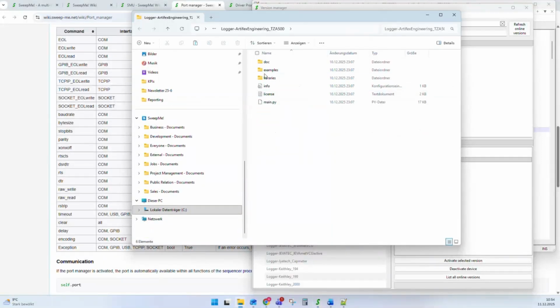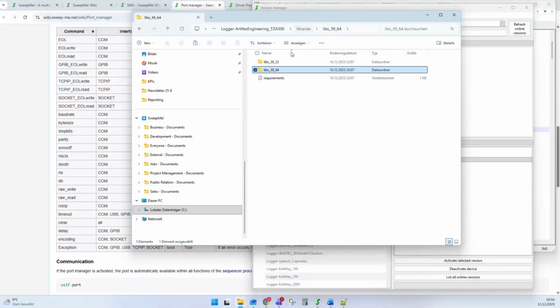And we can see you can add a libraries folder to your driver. And in this libraries folder, there can be libraries, for 64-bit and 32-bit, for example. And therein is, for example, now your library. And the easiest way to add a library is to use a requirements file. You add it to your libraries.